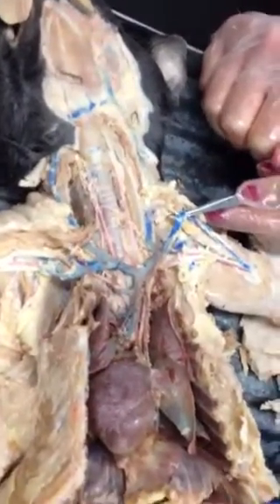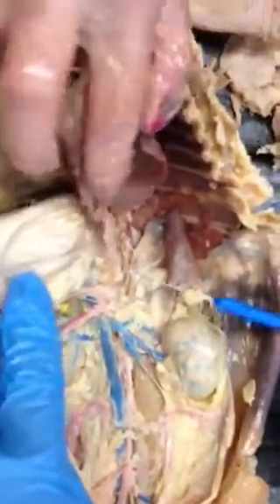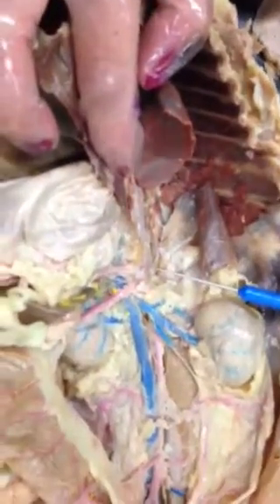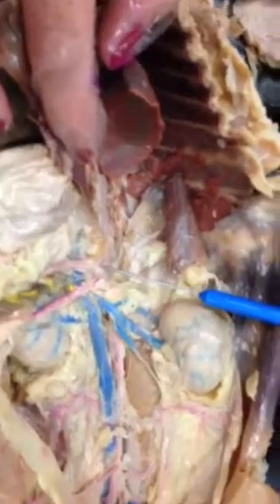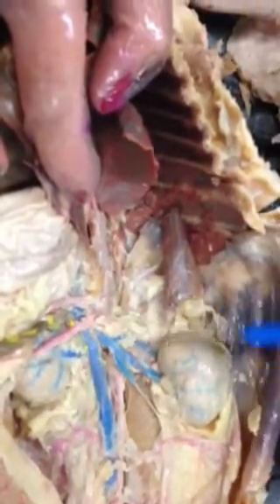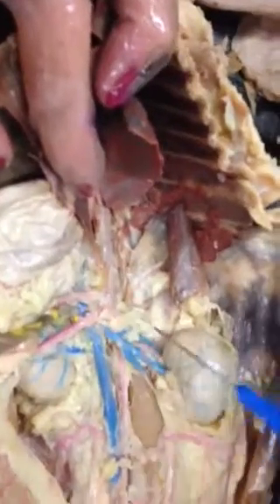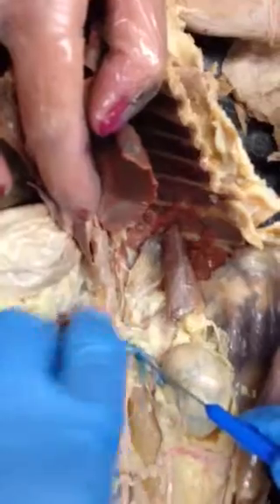We're going to move down the descending aorta. We'll get the stuff out of the way here. So this first complex that you see of some things branching off over here, anybody know what that's called? That's the celiac trunk. As you're progressing down, the next piece that's going to branch off is going to be your superior mesenteric artery, which is under this mess in here.